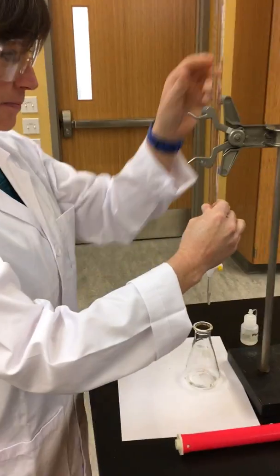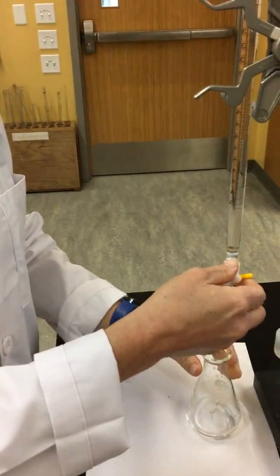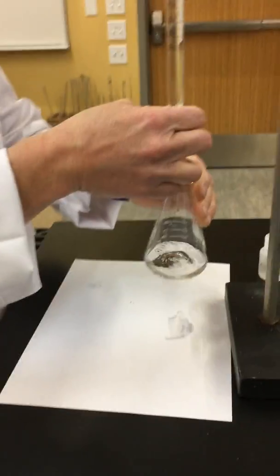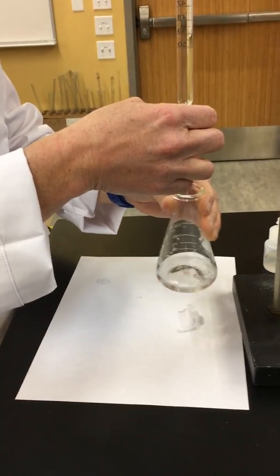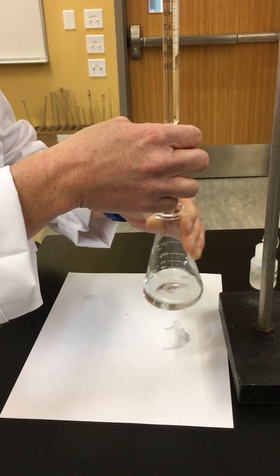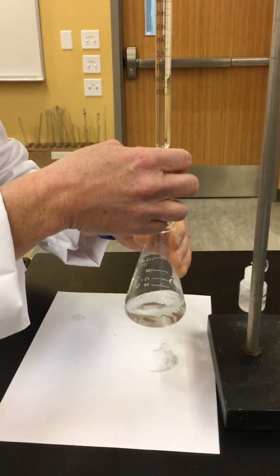Now we're going to begin our titration with hydrochloric acid. We're slowly going to add the sodium hydroxide to the hydrochloric acid solution. And we're going to be looking for that same pink color that we did in the first part of the experiment.